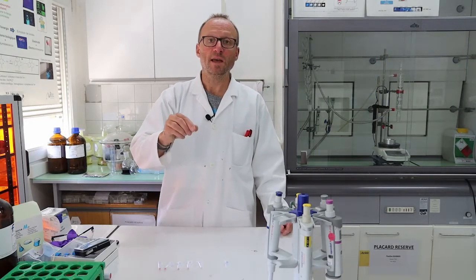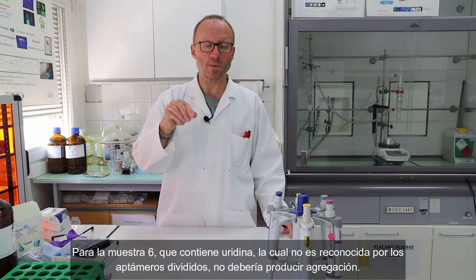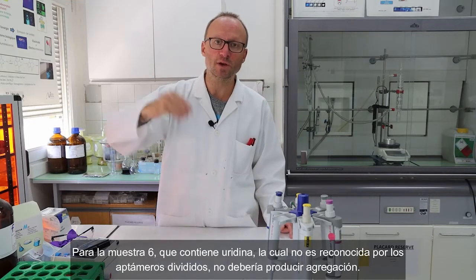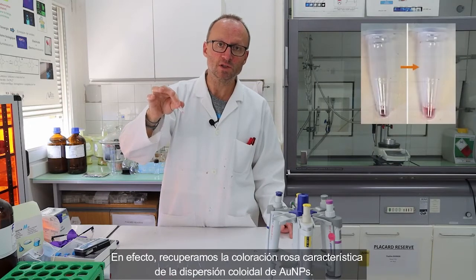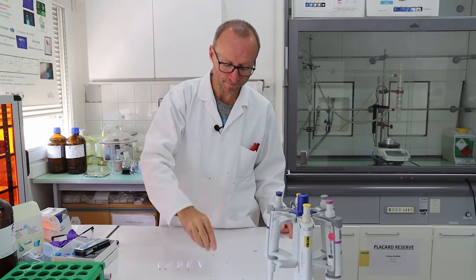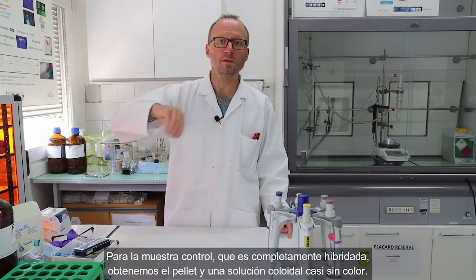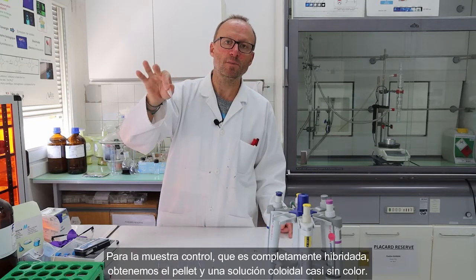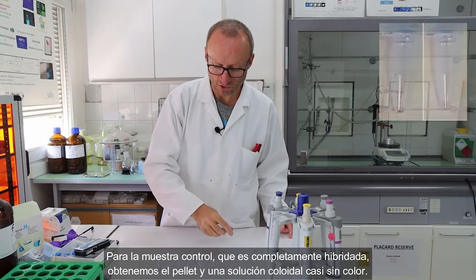Sample 6 is made with the uridine, okay, which is not recognized by the split aptamers, and that should not enable the aggregation. And indeed, we recover the pink color, which is characteristic to the full colloidal solution. For the control, it's fully hybridized, so we get the pellets, okay, and almost no color in the colloidal solution.